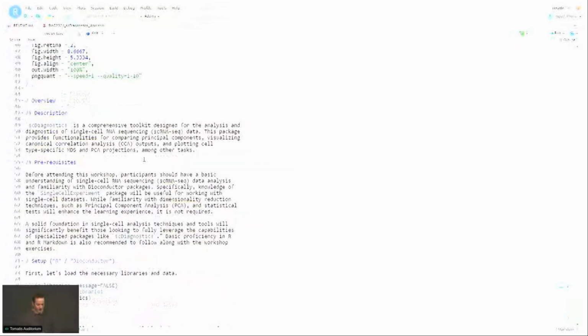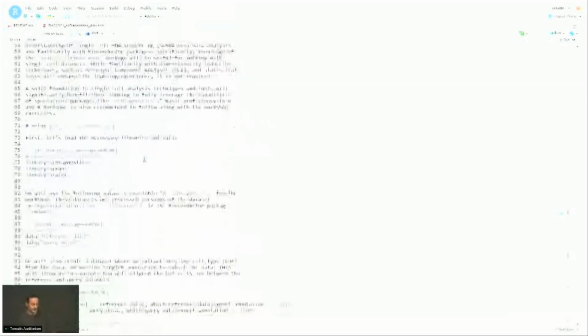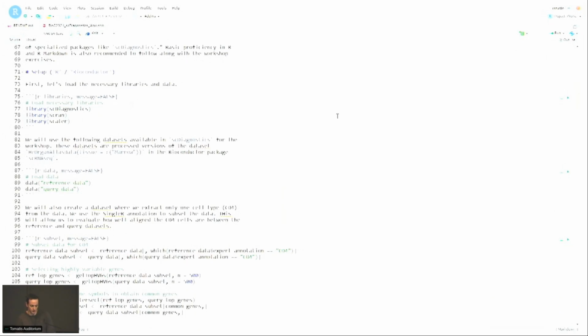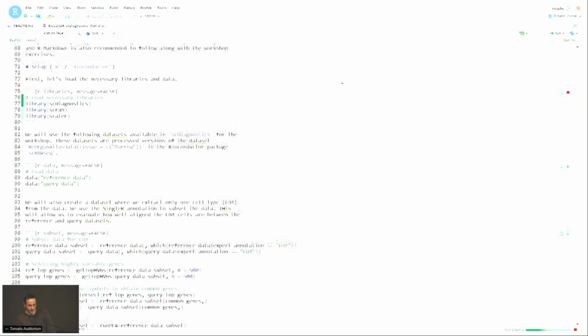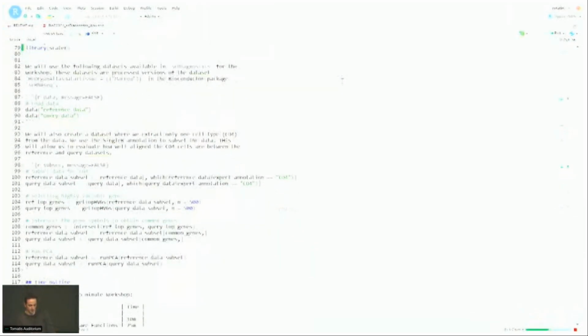Okay, there's a lot of text in the vignette, but mainly it's to give more context as to what the functions do. Some of them go pretty deep into the implementations and have a bit of advanced stats, so I won't go over them today, but hopefully we can eventually have a manuscript. I was playing around with the workshop last night, and some functions take quite a bit to compute, so please bear with me.